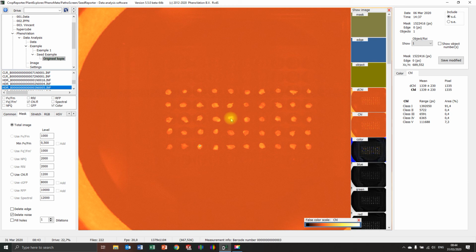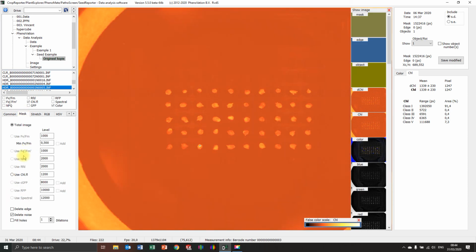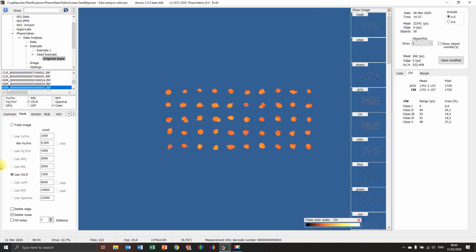So what do you look at? These are way bigger seeds. If I take a look, those have a chlorophyll of 2,500, lower 1,600, and they're way bigger. So I'm going to lose this one, because now everything bigger than 420 is also allowed. Probably the seeds were too big for this. So mask it again. Now it's too low. You see a small pixel line disappearing, so I put it on 1500. And there it is again.